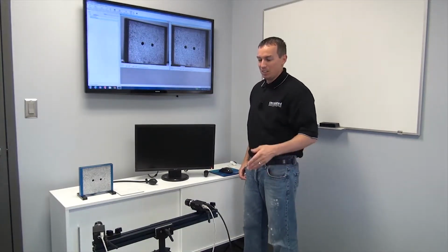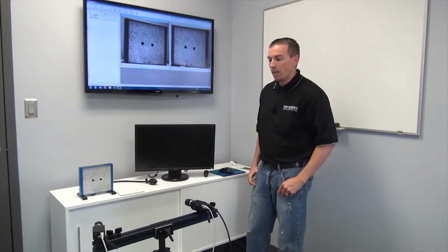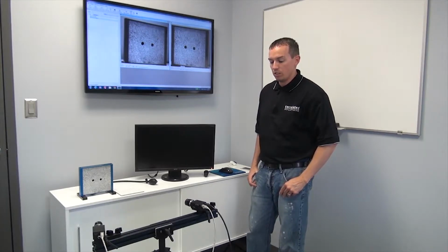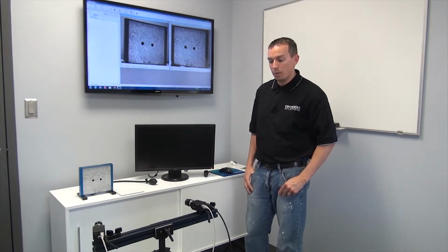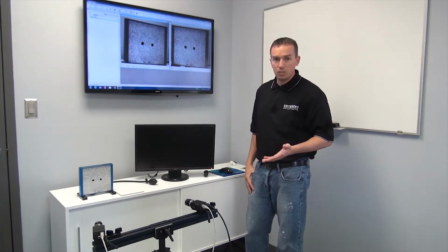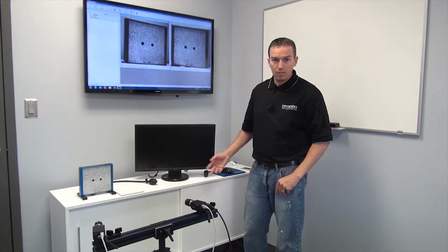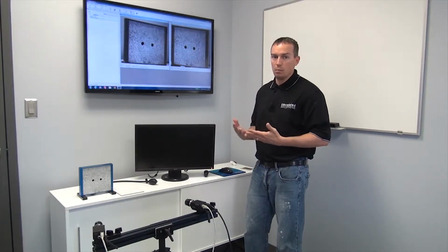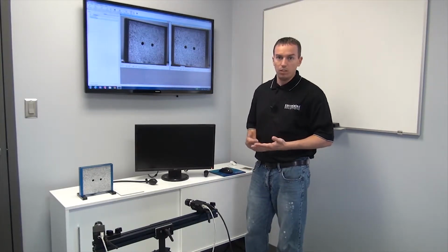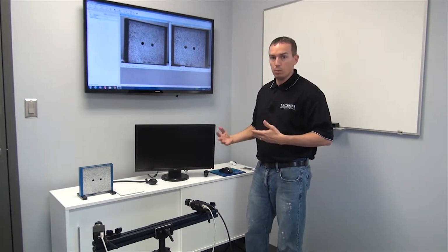So here is our setup of our image correlation system, the Vic3D 5 megapixel system. Basically this is an image correlation system for measuring three-dimensional deformation. If you're not familiar with image correlation, it's a measurement system that engineers use to measure mechanical properties of materials, which can be used to research, study and analyze how your specimen, your component or your product is deforming under different loading conditions. Engineers use that to validate models and therefore make a better, cheaper product.